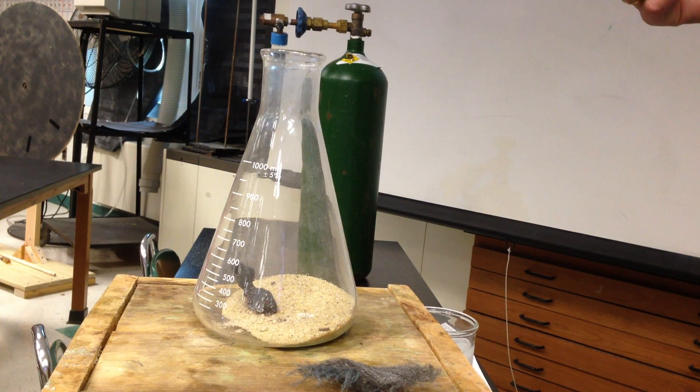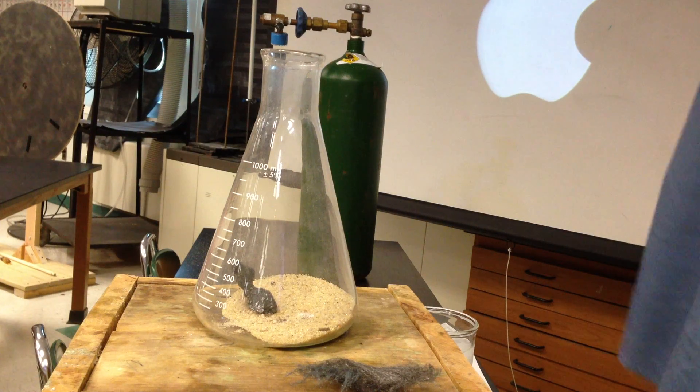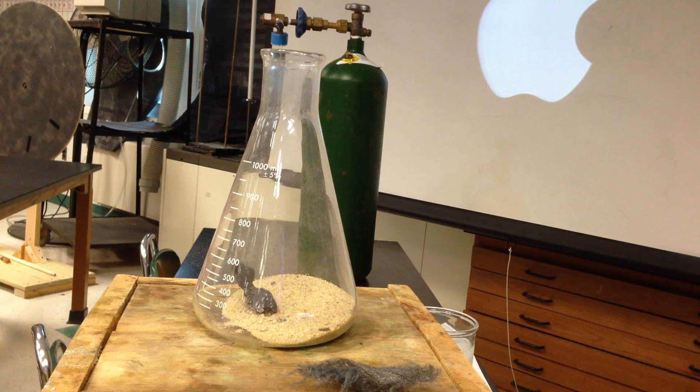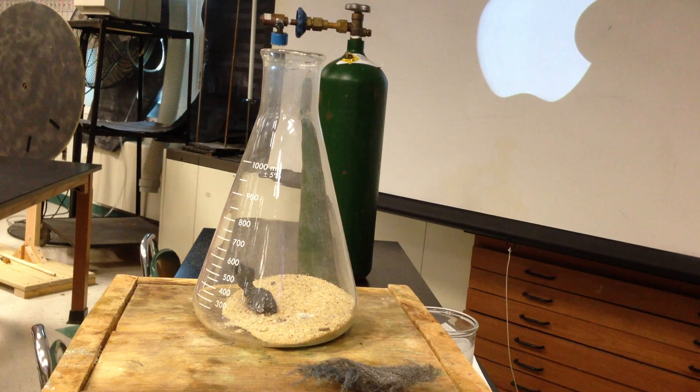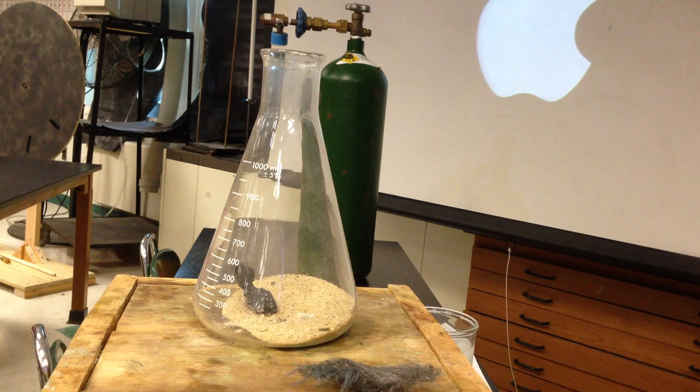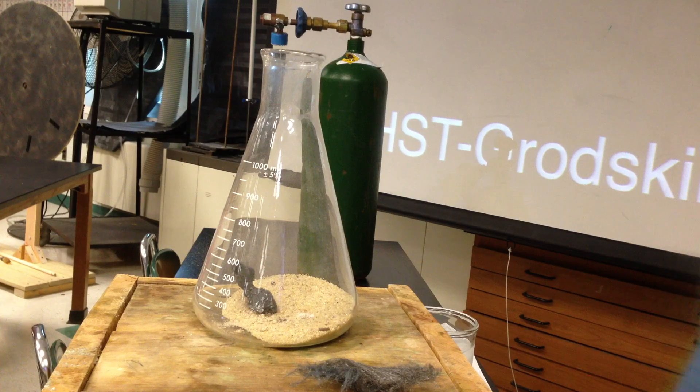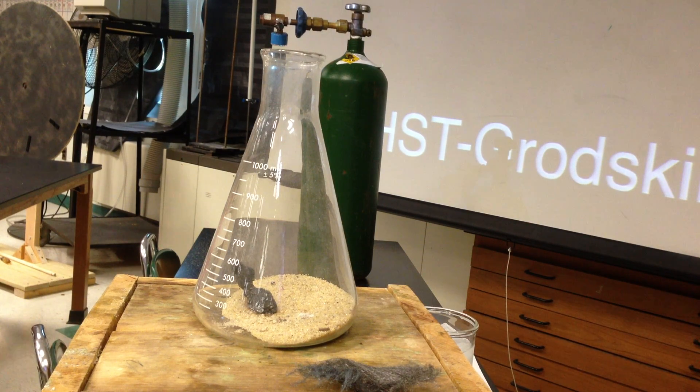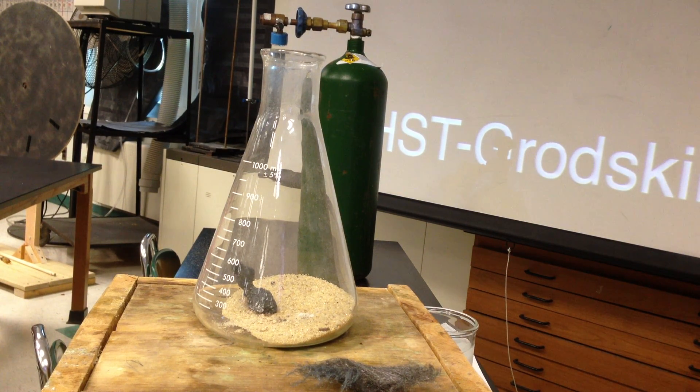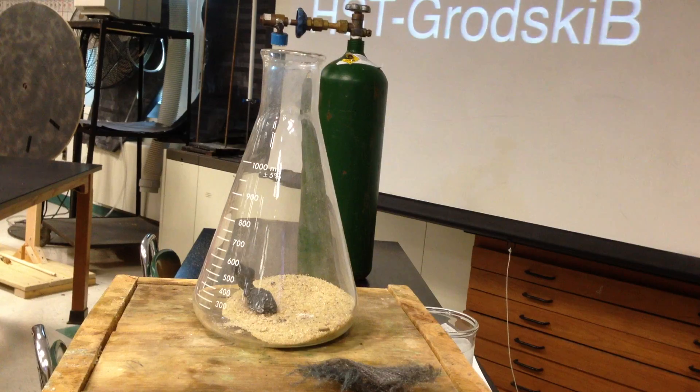So I increased the rate of reaction by increasing the concentration of the oxygen. The reason why you don't smoke in a hospital is that that's what would happen to your cigarette, especially in a room that's been pumping a lot of oxygen. The rates of reaction are much, much faster if you've got more reactants.